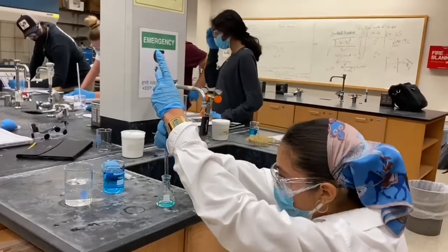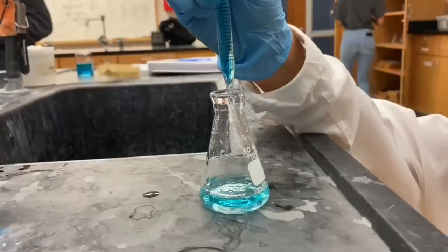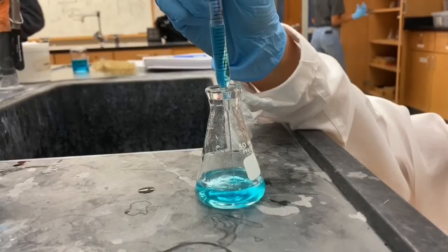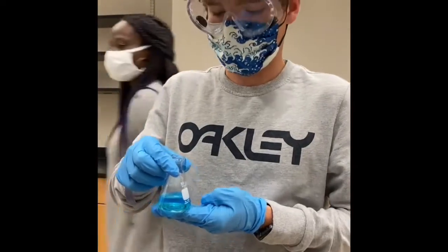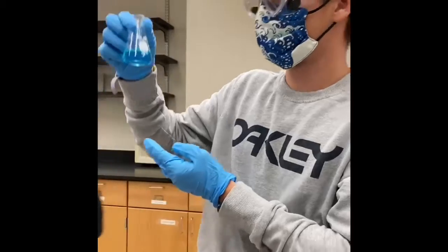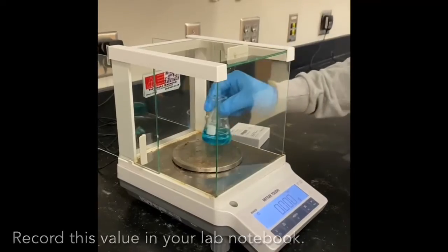We are now going to dilute it to the 30 milliliter mark with the water from the pipette. We have now reached the 30 milliliter mark of our diluted solution. Here we have our diluted solution. That's when we add water to decrease the concentration of the sugar inside the original stock solution. We are now going to find the mass of our diluted solution.